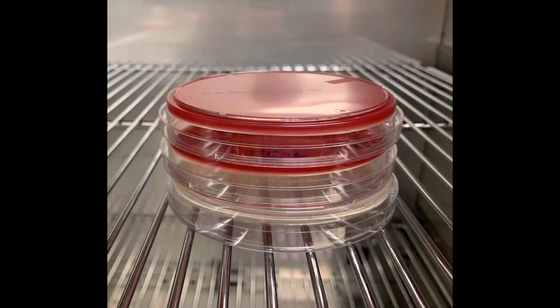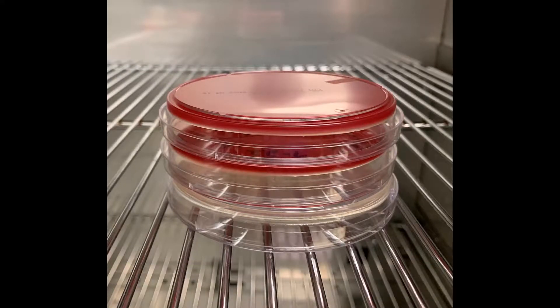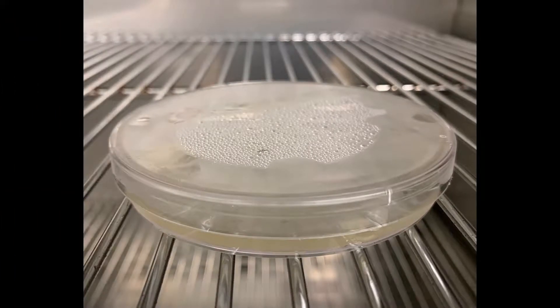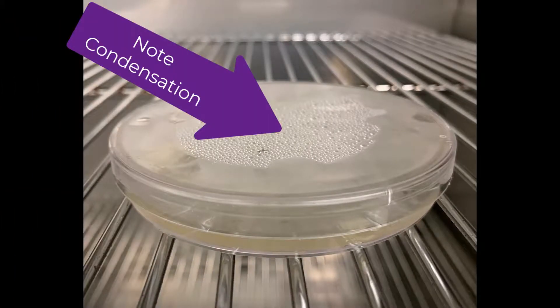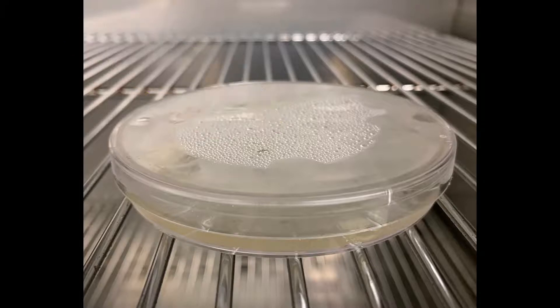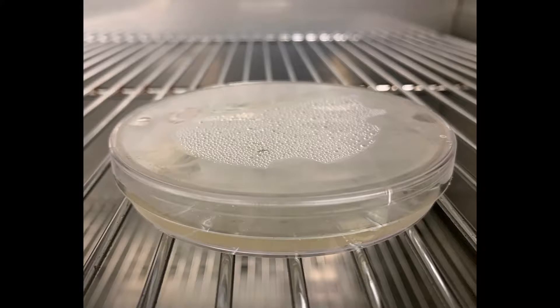Plates get incubated upside down. The environment in the incubator is usually warm and humid. When plates are incubated with the cover up, condensation will form and drops will fall onto the surface of the agar, splattering the bacteria all over the place and really confusing your results.